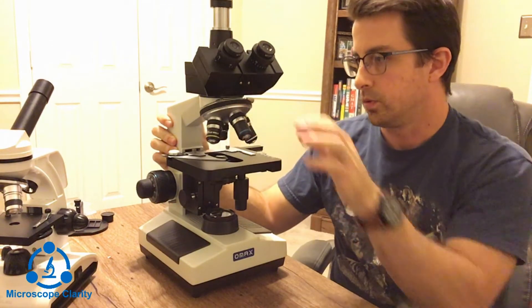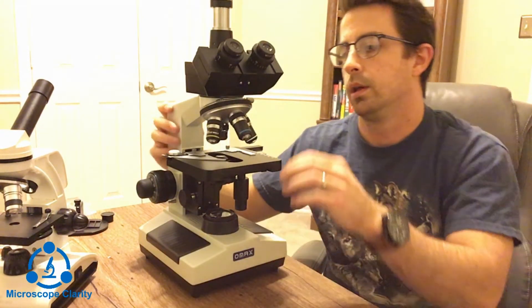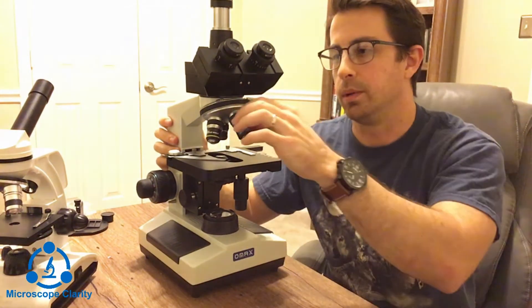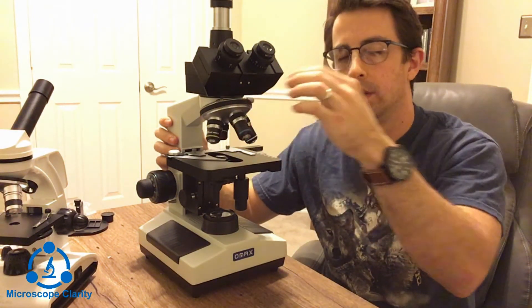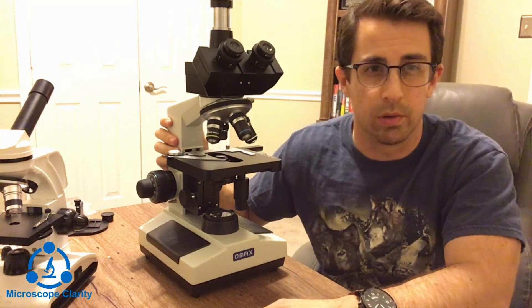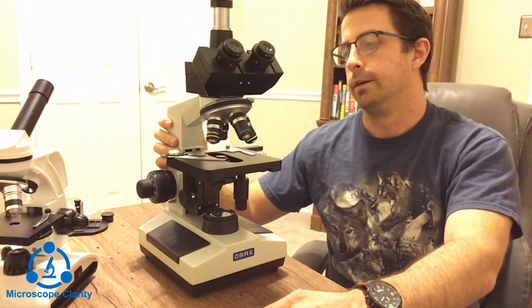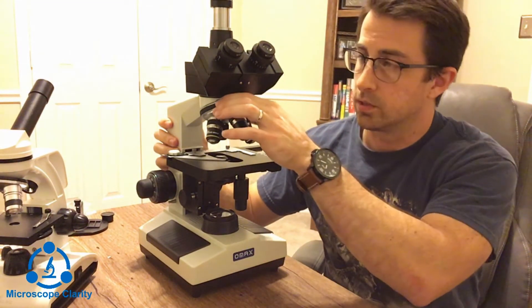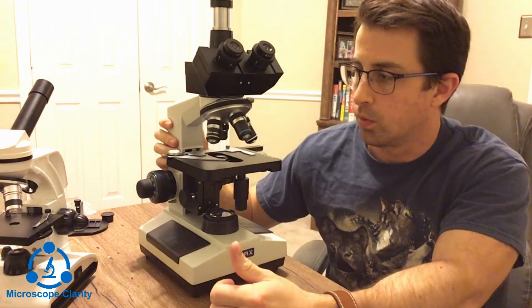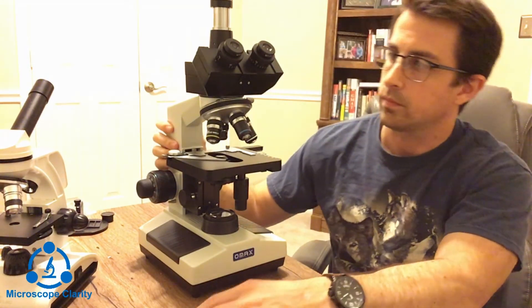The objectives are similar to those on the simple microscope, except these are made to the DIN standards, which means you can unscrew and replace them with other microscope objectives of the same standard. The revolving nosepiece on this microscope has four objective slots, so it can hold four objectives at a time.